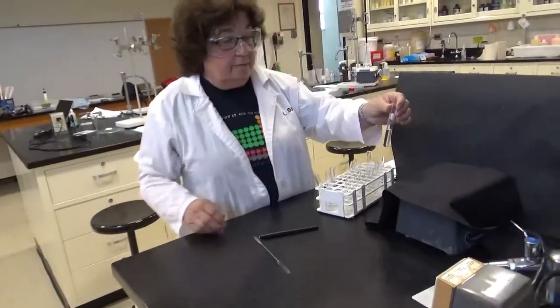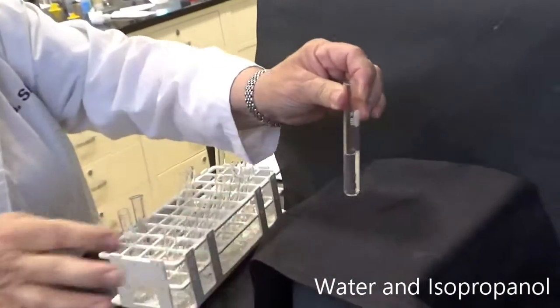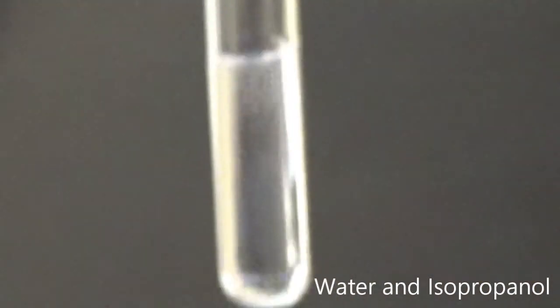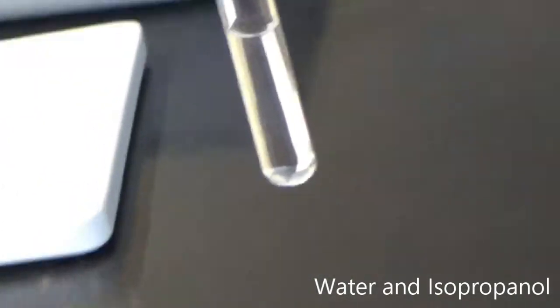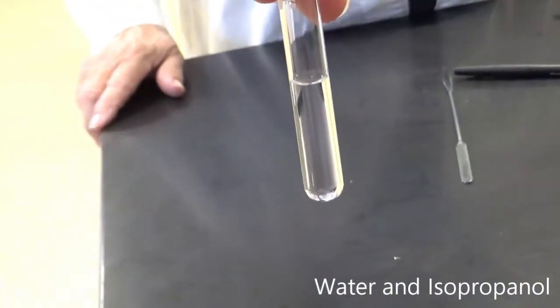Isopropyl alcohol in water, again, about equal amounts. And is that cloudy or clear? Our next one is butanol.